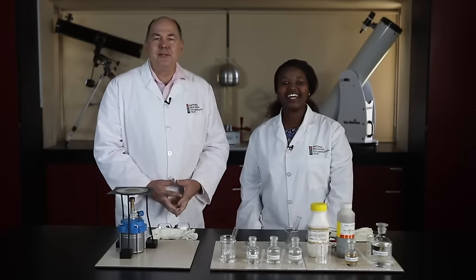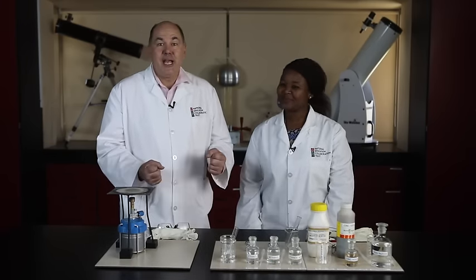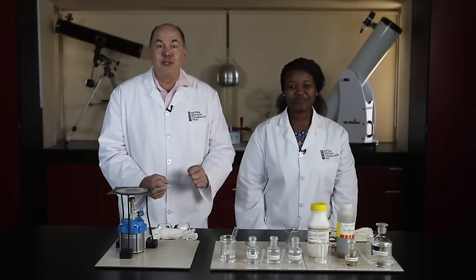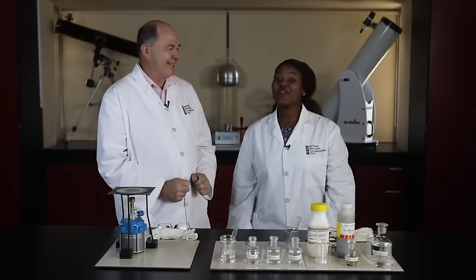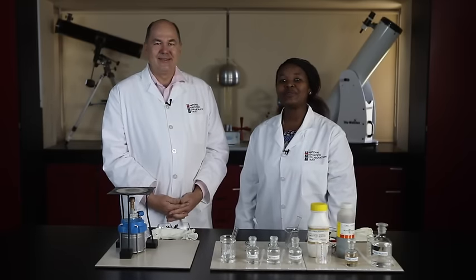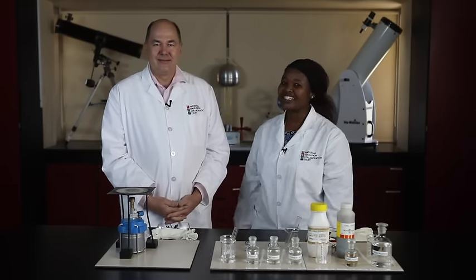Hi Grade 12s, I'm John McBride and I'm Joyce Polko. Today we are putting organic chemistry into practice. We are making esters. Although you won't be able to smell these fragrant compounds, you will be able to see the process of making them in small quantities.